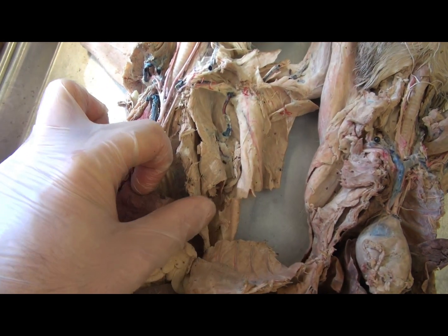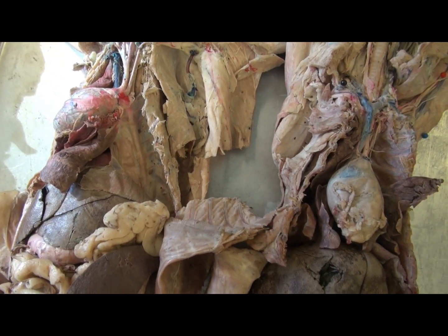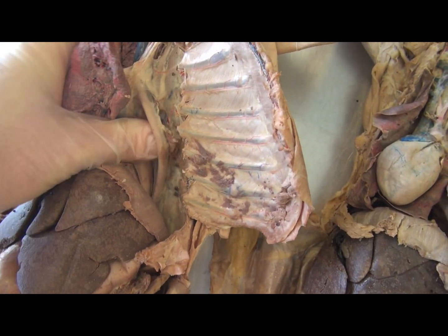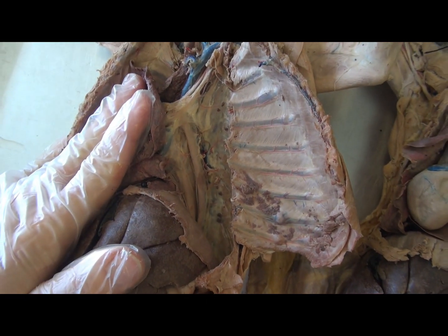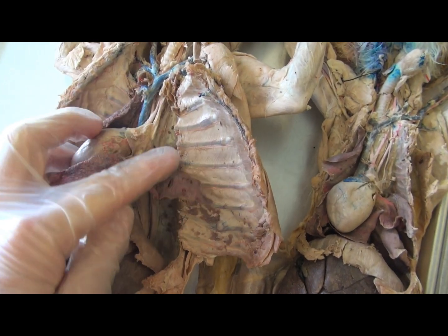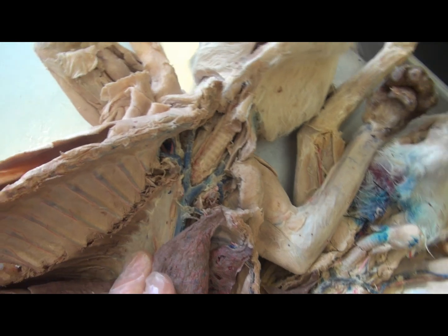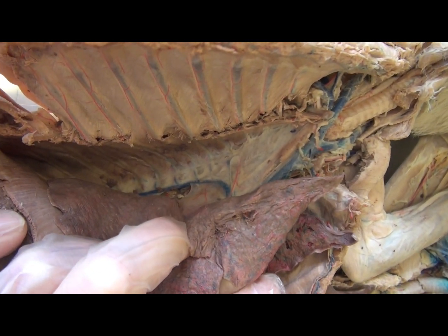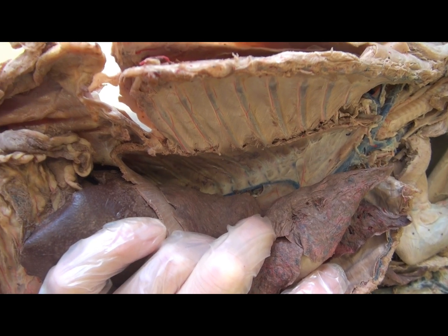The arch of the aorta has those two superior branches, but proceeding inferiorly from it is the descending aorta, which can be broken into the thoracic aorta in the thorax and then the abdominal aorta. When one pulls the lungs to expose the left side, one can observe the thoracic aorta proceeding from the arch. On the right side, when one pulls the right lungs back, what is observed is not the superior vena cava but rather an alternate route back from the inferior portions of the body — the azygos vein.